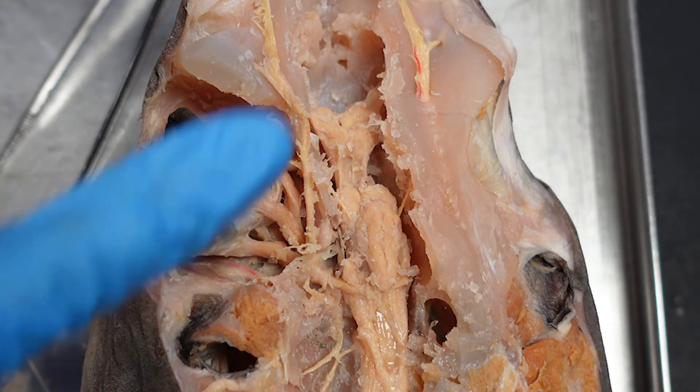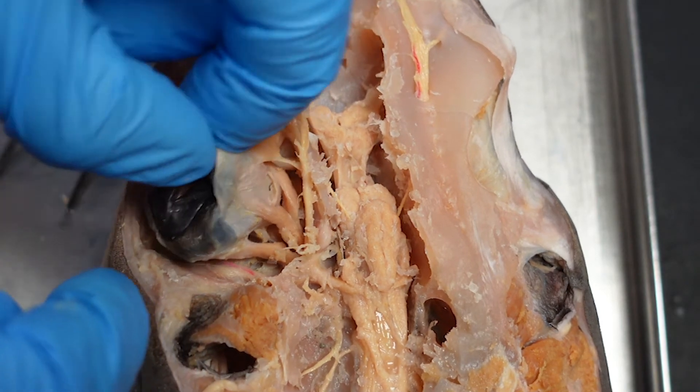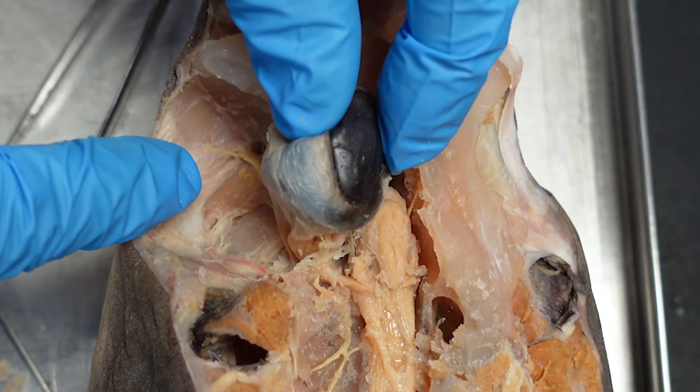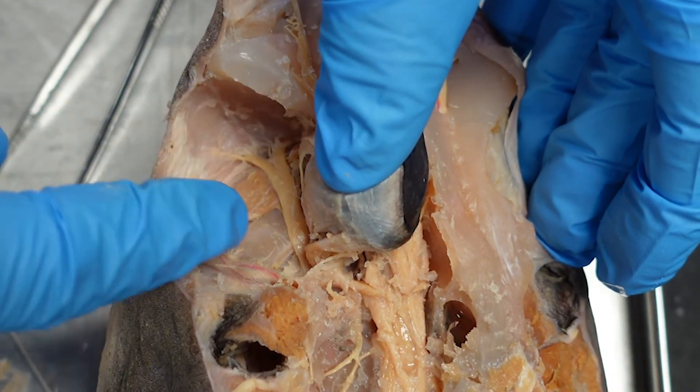What we're looking for here is a cleared-off center part of your brain, investigation of the branching, the eyeball being able to lift up to look at your infraorbital trunk down here, and that surrounding material cleared out.